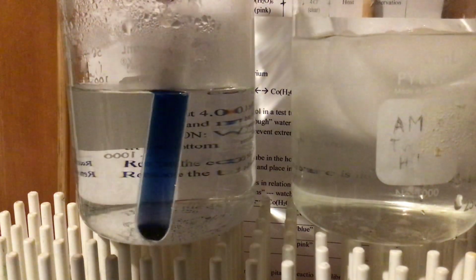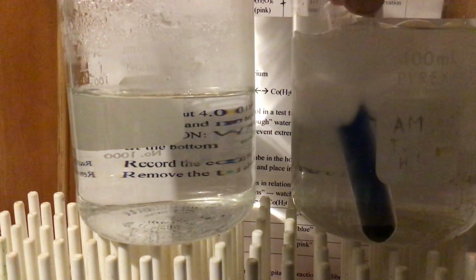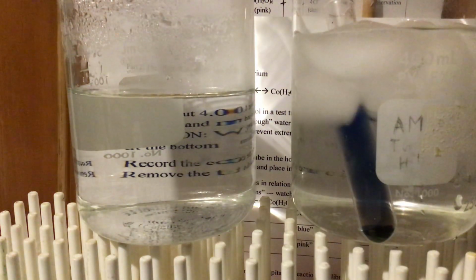Okay, you think I'm probably putting something else in there. I'm not. Trust me. I'm sure you do. Yeah, right. And I put it in the ice bath and we'll see what happens to it. All right, and then we're going to kind of figure out this thing about the equilibrium shifts.